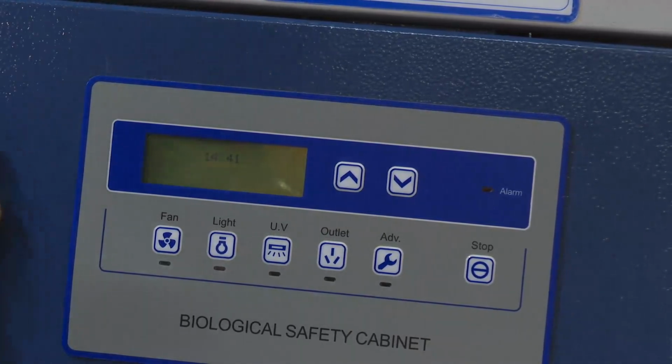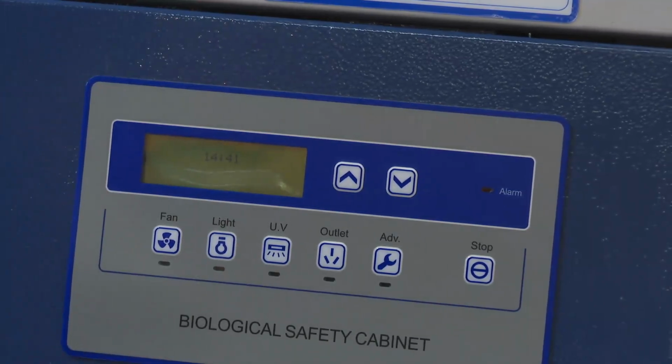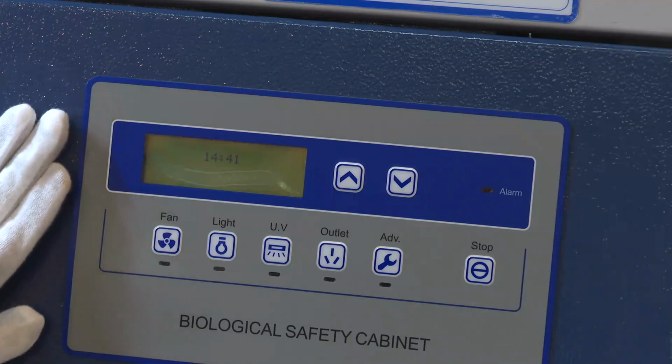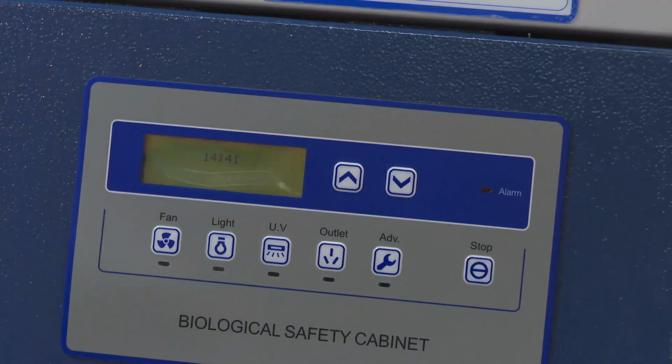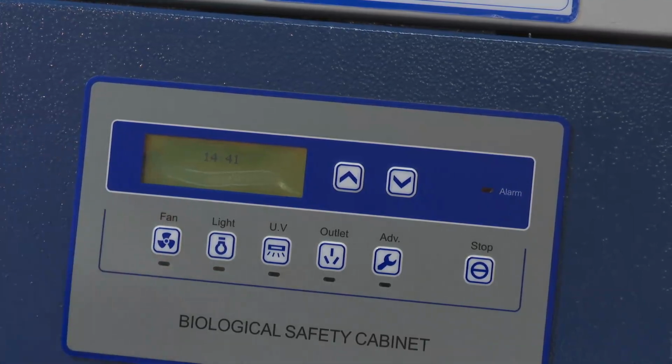Before changing the set values, they must have the set values from a technician, to avoid making a mess. And regarding the offset value, it is better to contact your technical support to confirm the normal value. If not, maybe you make a mistake here. Airflow will be kept here always. Okay, please feel free to connect with us.